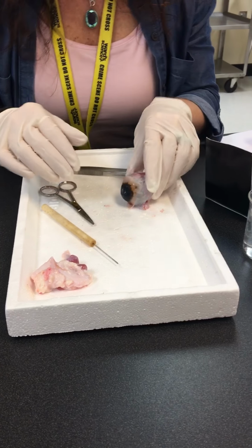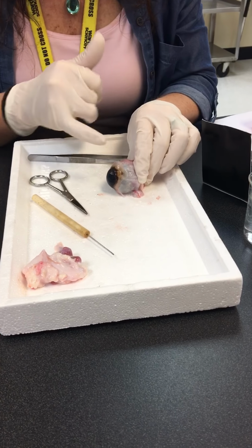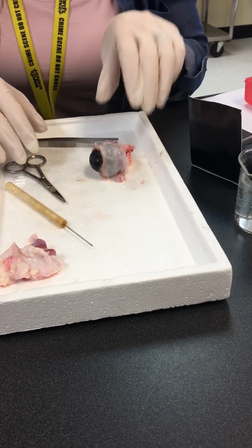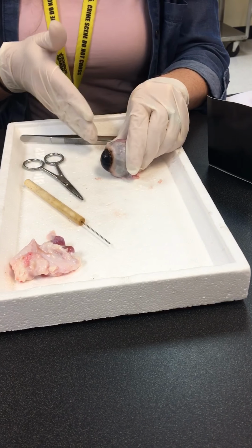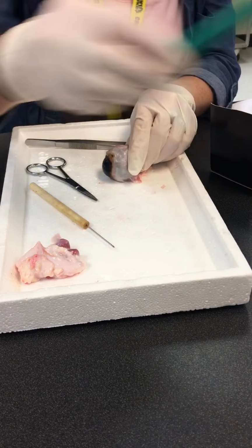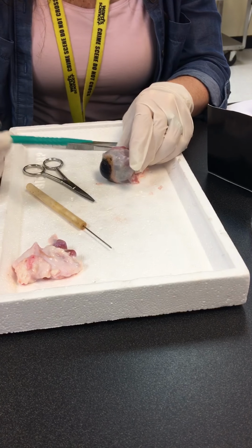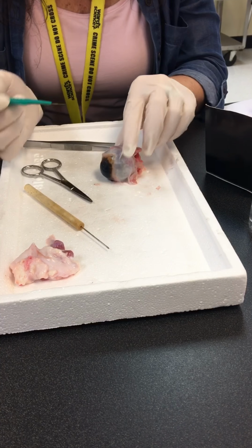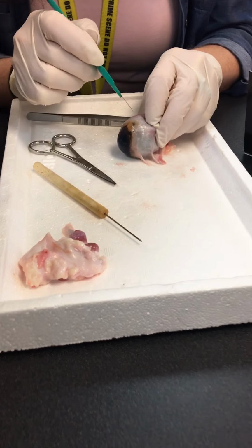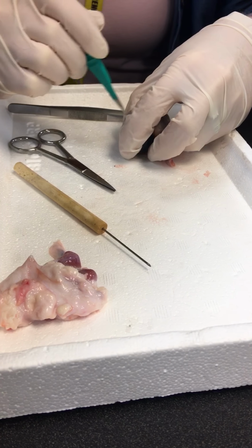All right, so what we're gonna do is I'm going to try and do this where I don't damage this, but I'm gonna cut just right behind this lens structure. I'm gonna cut right behind there, and I'm gonna cut this in half, okay? So we're gonna take a look at the inside. The sclera is very tough, okay? And we're gonna take a look at all the layers here. So it may take me a little bit to get even a puncture through here, because this is a very tough layer.